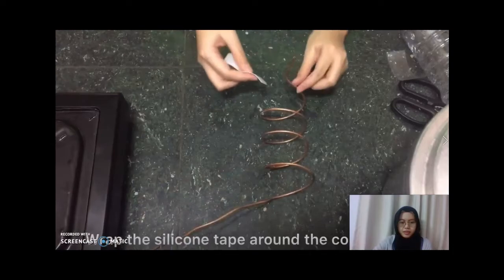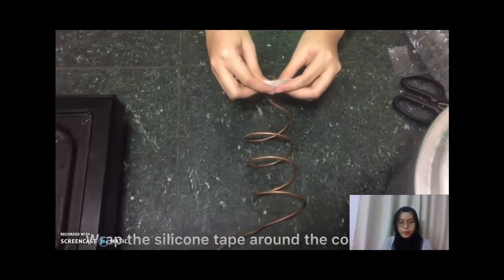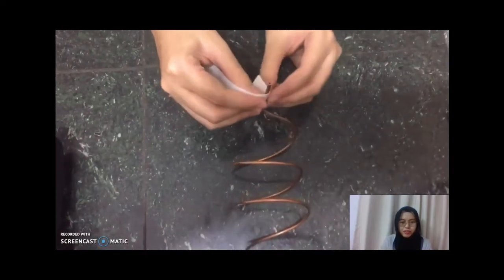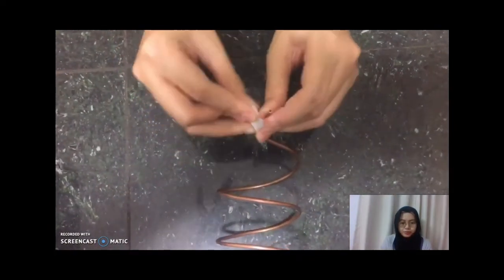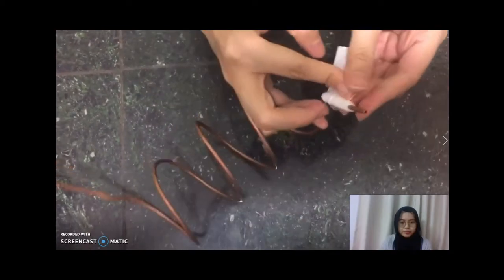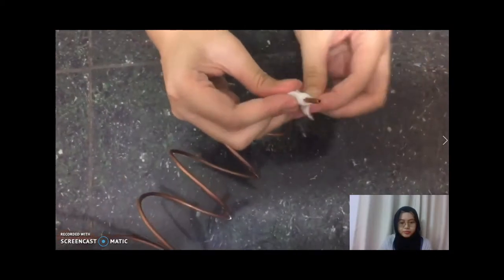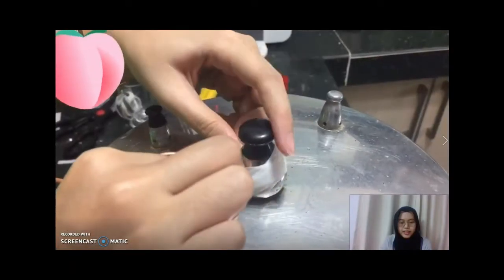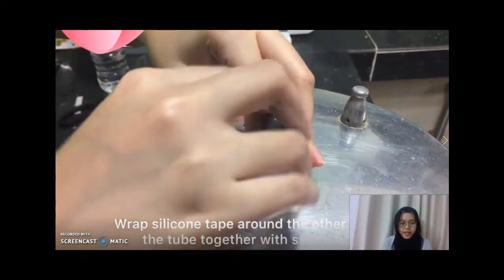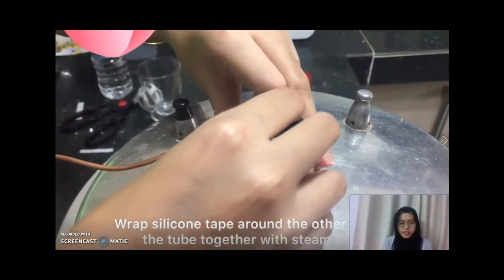The silicone tape is wrapped around the copper tube at the end of it to make sure that there is no water leaking through the hole. Then take the other end of the copper tube and wrap it together with the steam hole using the silicone tape.